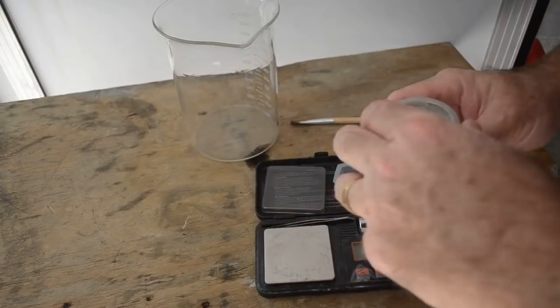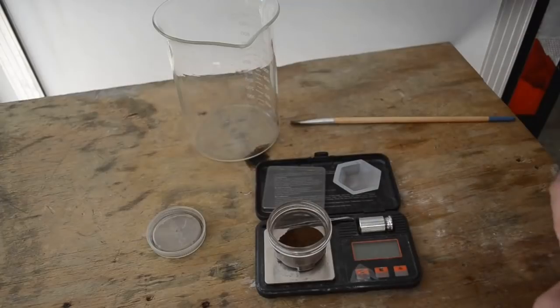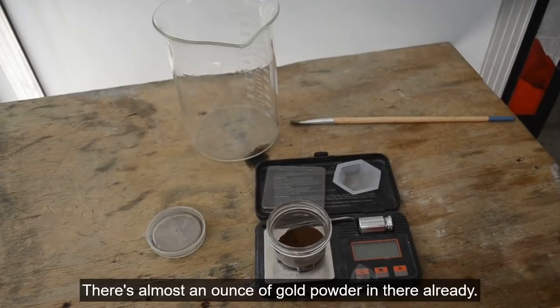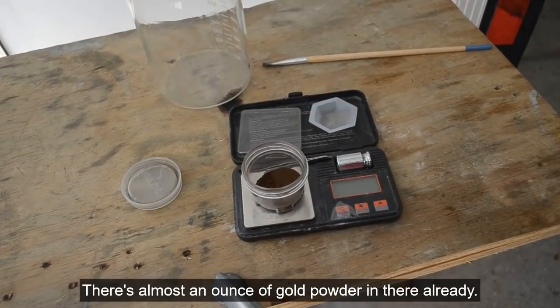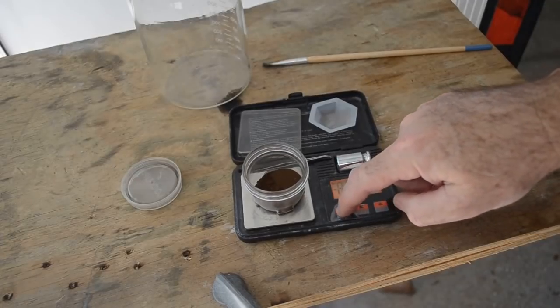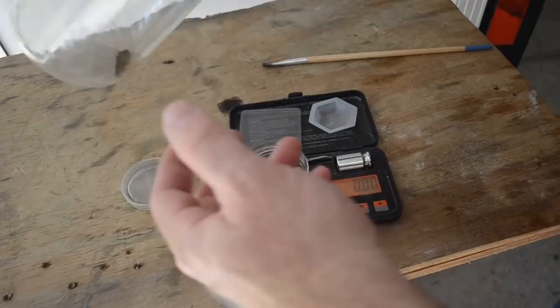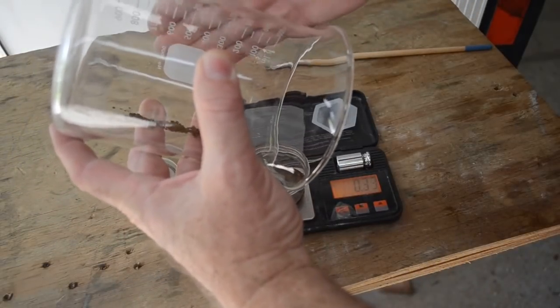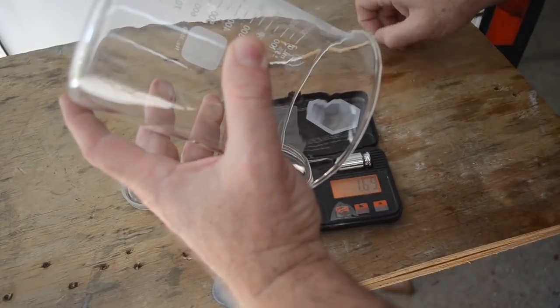Actually, you know what? Because it's a little breezy out here, I'll just dump it right into my impure gold powder container. That little weigh boat would be shook by the wind, and we wouldn't get a good reading. So let's get the scale turned on. Okay. Hey, holy cow.